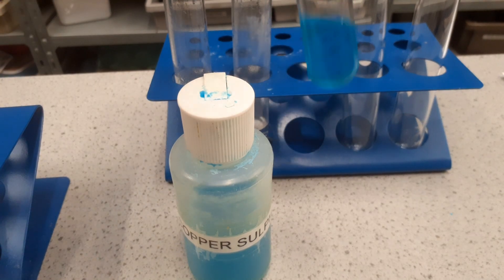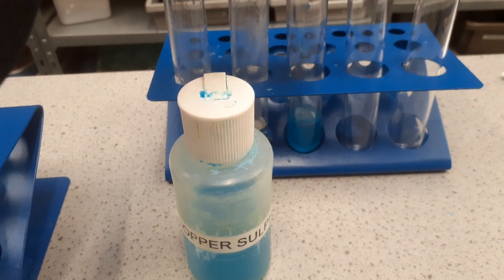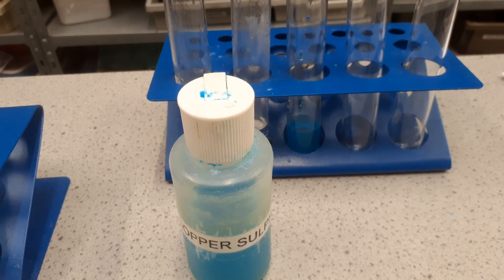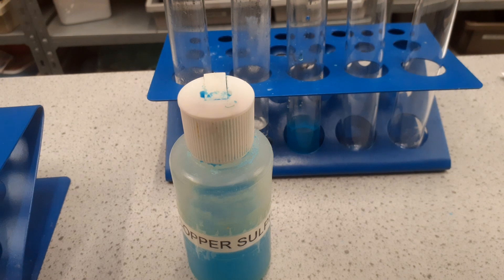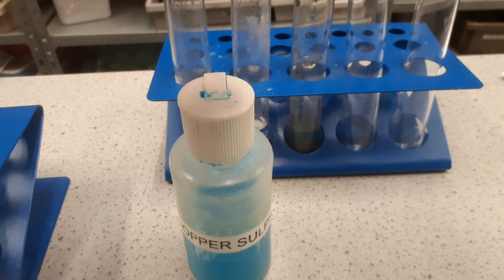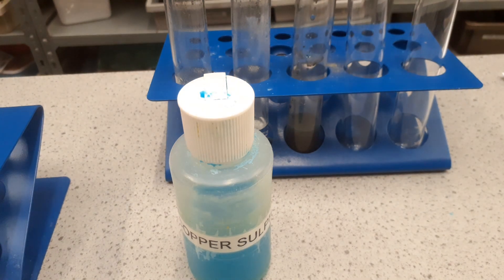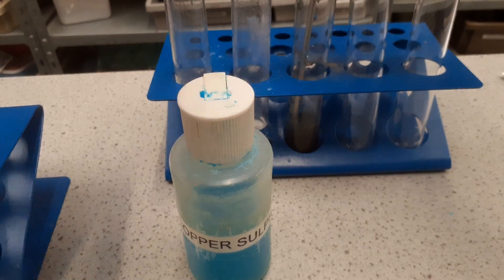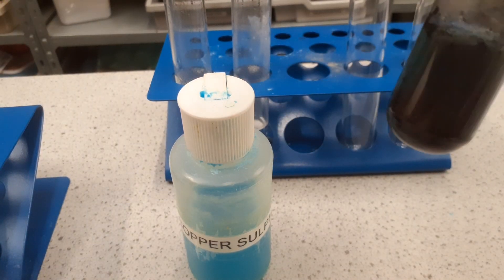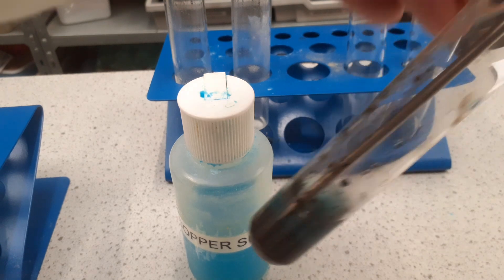Our third experiment - we're going to use copper sulfate solution. Again, the start temperature is 18.1. To that I'm going to add powdered zinc, two spatulas. We'll look then for a final temperature. Stirring it - after starting at 18.1, you can see that the temperature is rising.